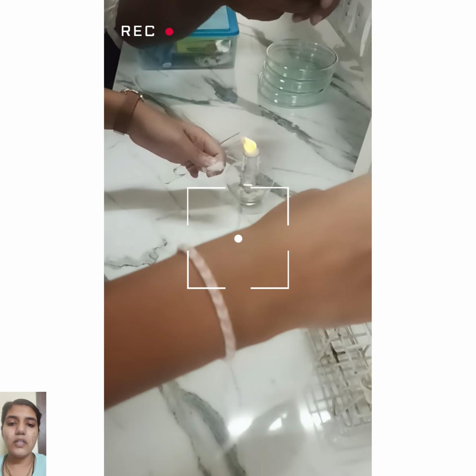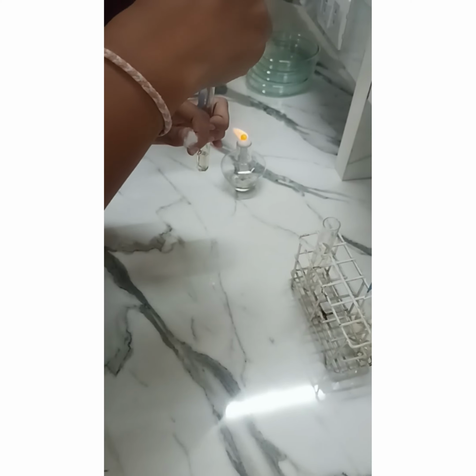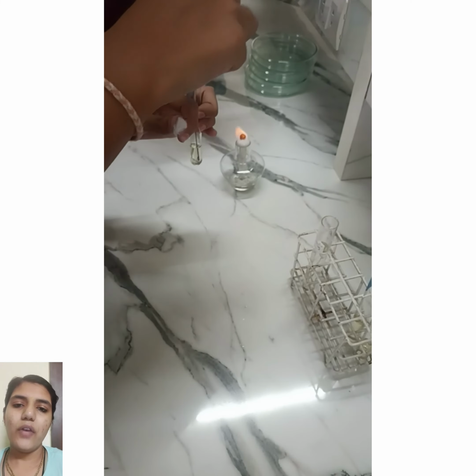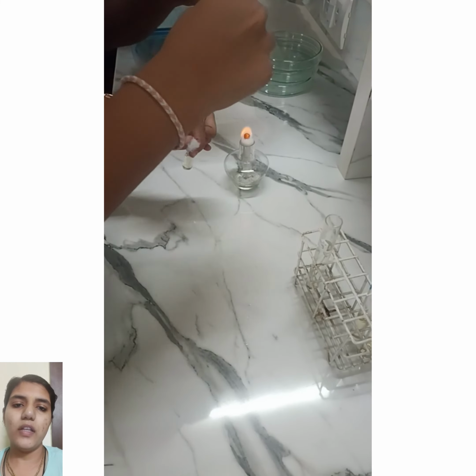So after heating up the test tube and putting the inoculating loop that contains contaminated bacteria in the nutrient broth test tube, stir it for about 10 seconds, and then sterilize both the inoculating loop and the test tube of nutrient broth above the flame to prevent contamination, close the test tube of nutrient broth with the cap and place it back in the test tube holder.